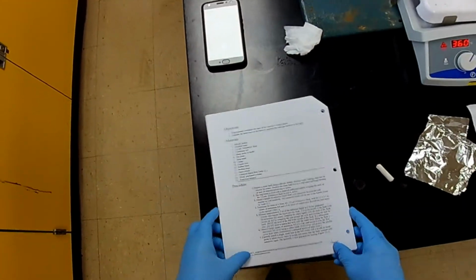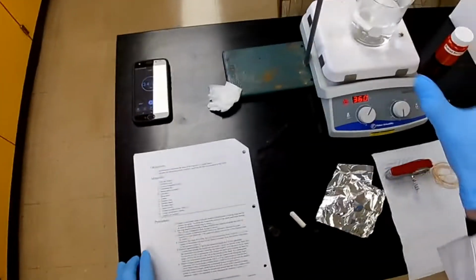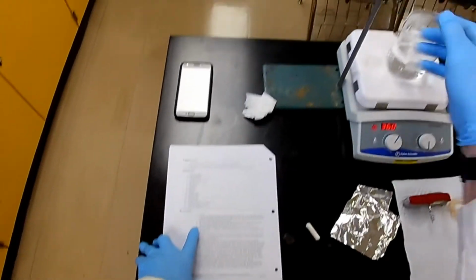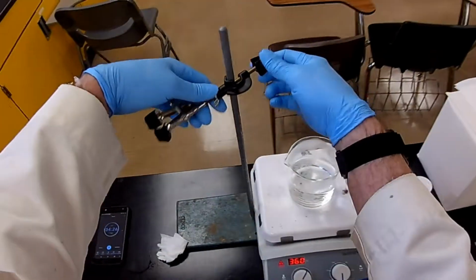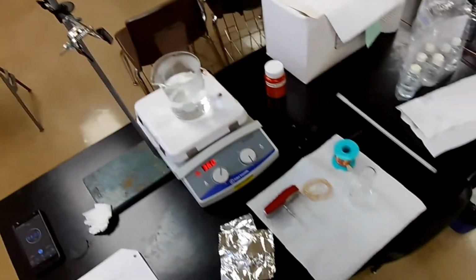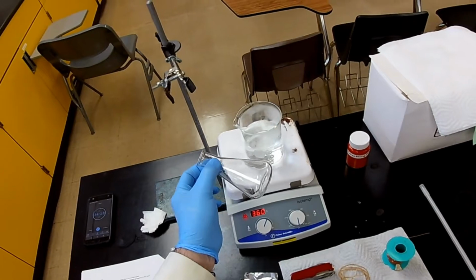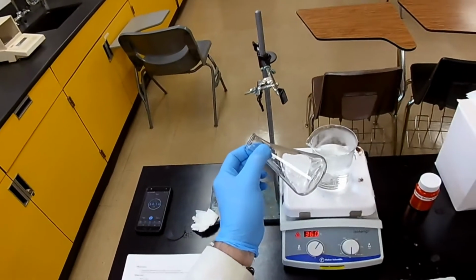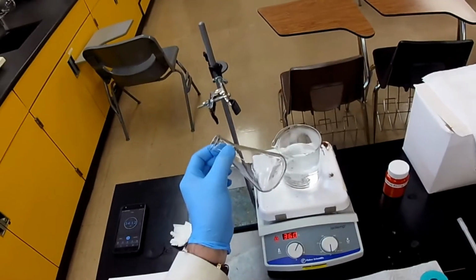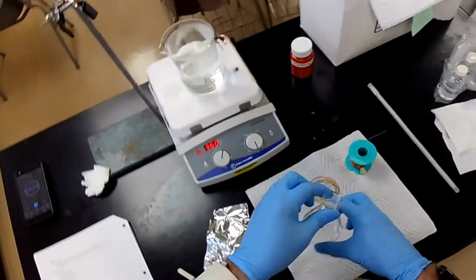That's going to be a direct measurement. We got the water bath prepared. We got the ring stand with a clamp. Now, why do we need a clamp? Well, when we try to submerge this in the water bath, it doesn't want to go. It's going to try to float, and we need to submerge it as far as it'll go. So we clamp it in here and hold it down.